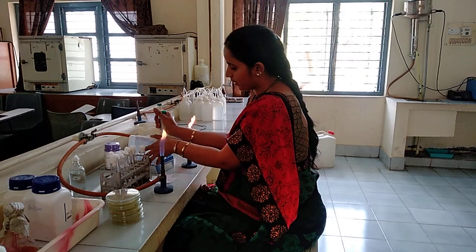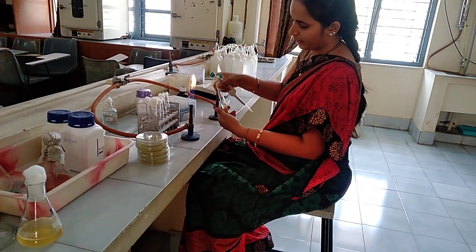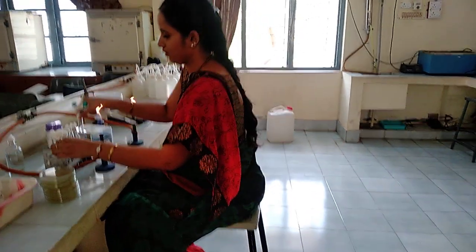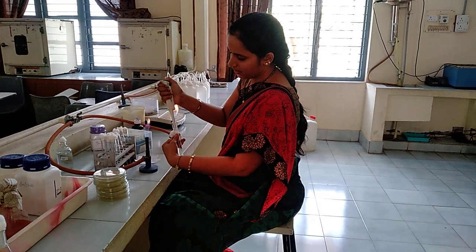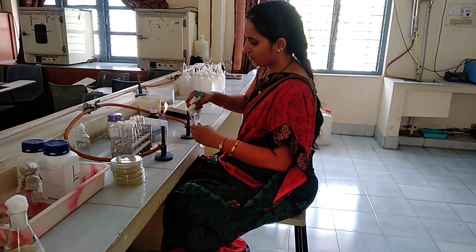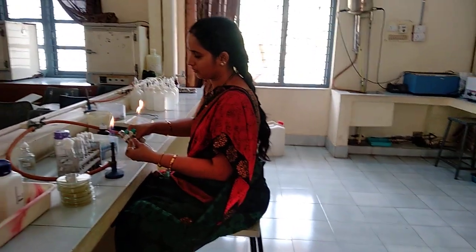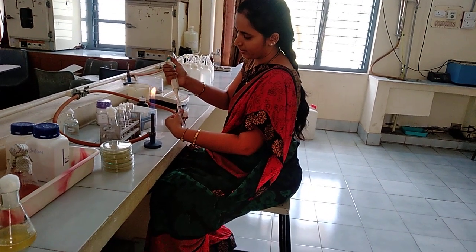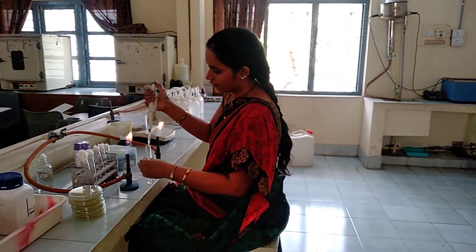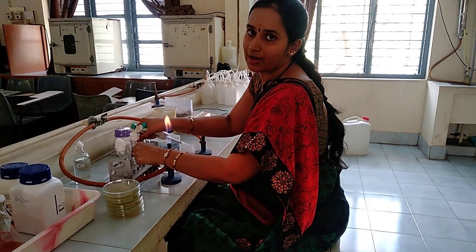For serial dilution, we need to be ready with the test tubes. Mix the stock solution properly. Take about 1 ml and go for the serial dilution — dispense 1 ml into the first tube, mix it properly using the pipette, then take out 1 ml from the first tube and insert into the second tube. Continue taking 1 ml into the next tube, bringing you to 10 to the power of minus 3 dilution. Every time you need to mix it properly and then take the sample.